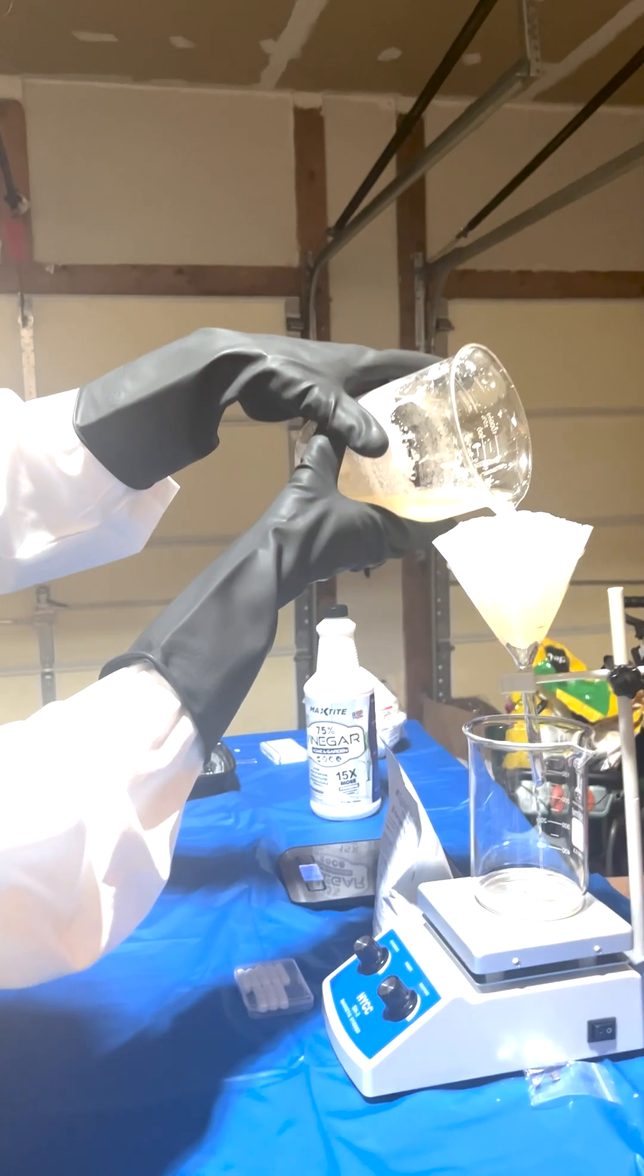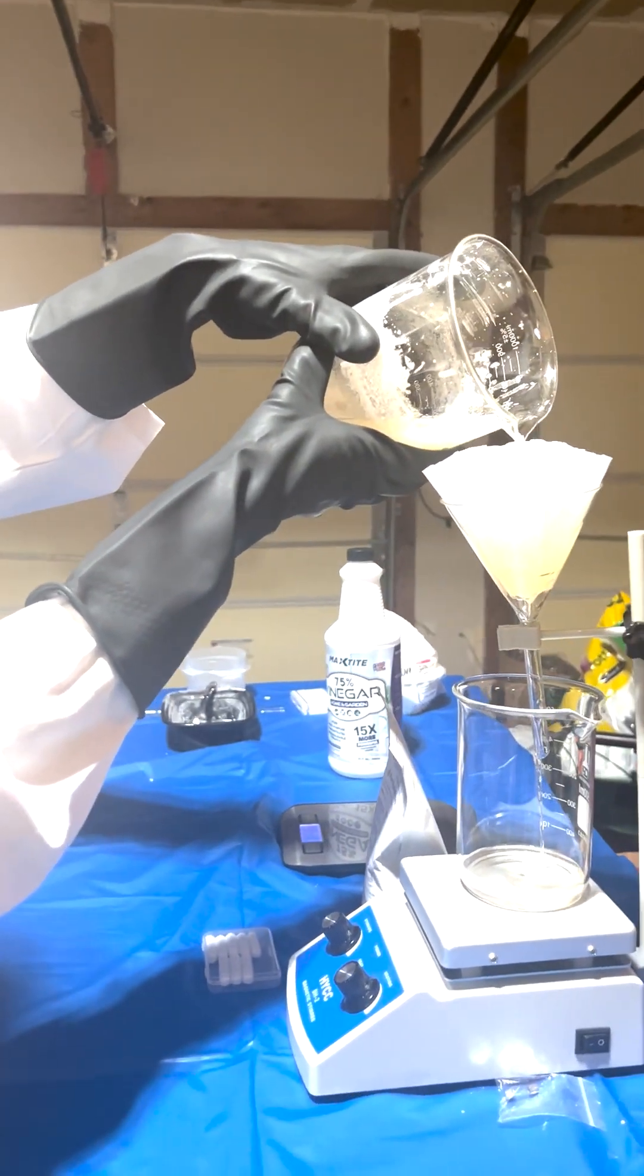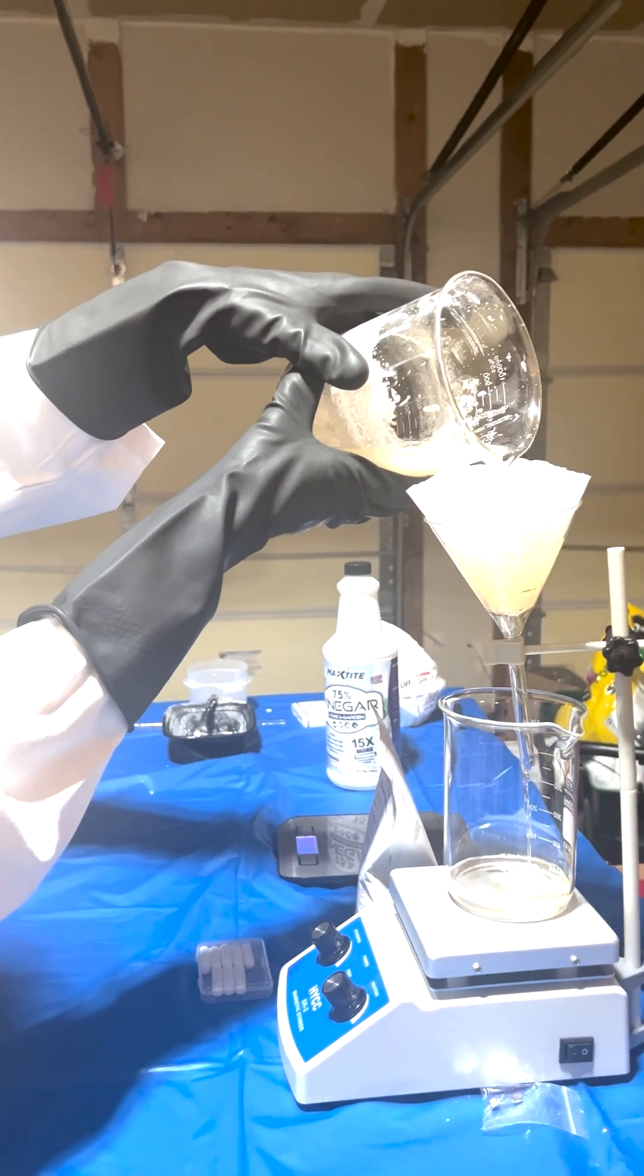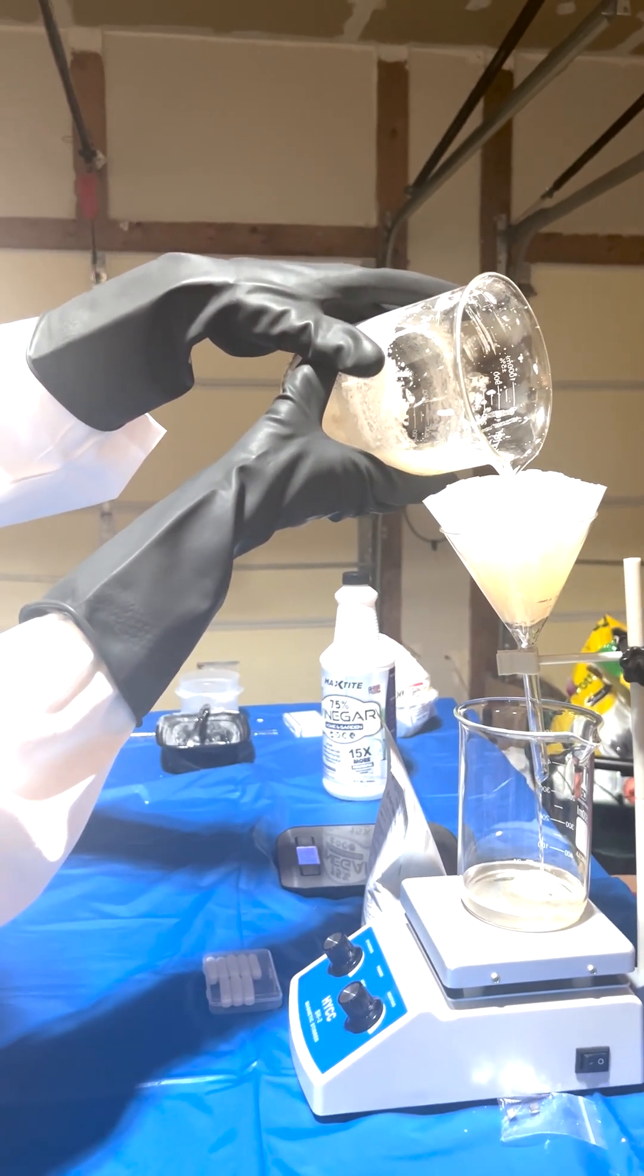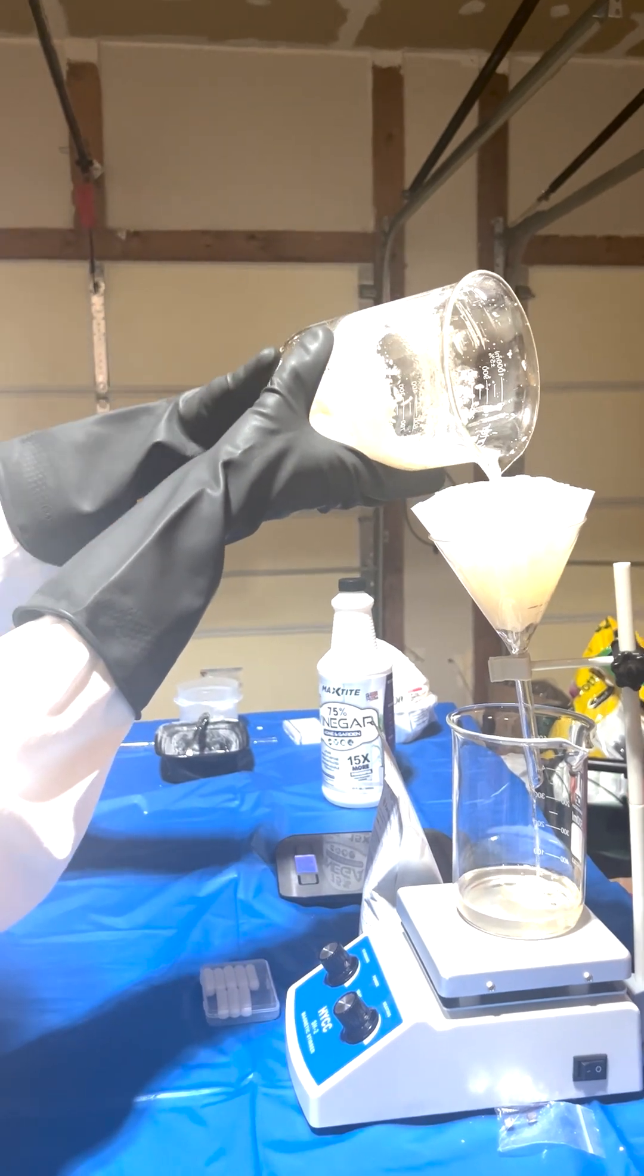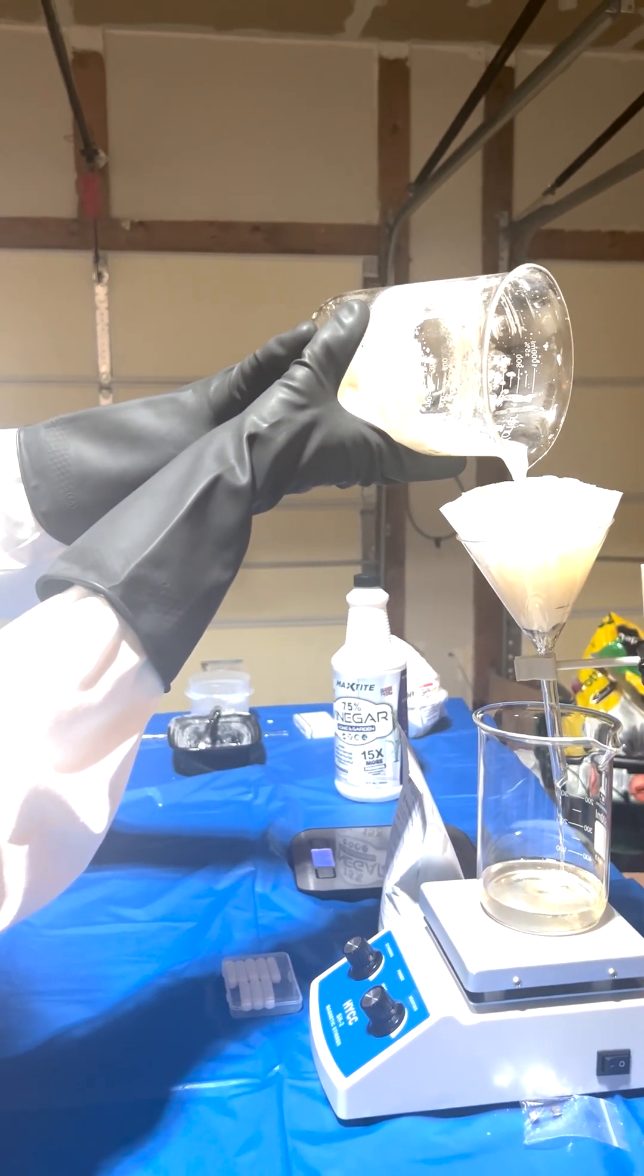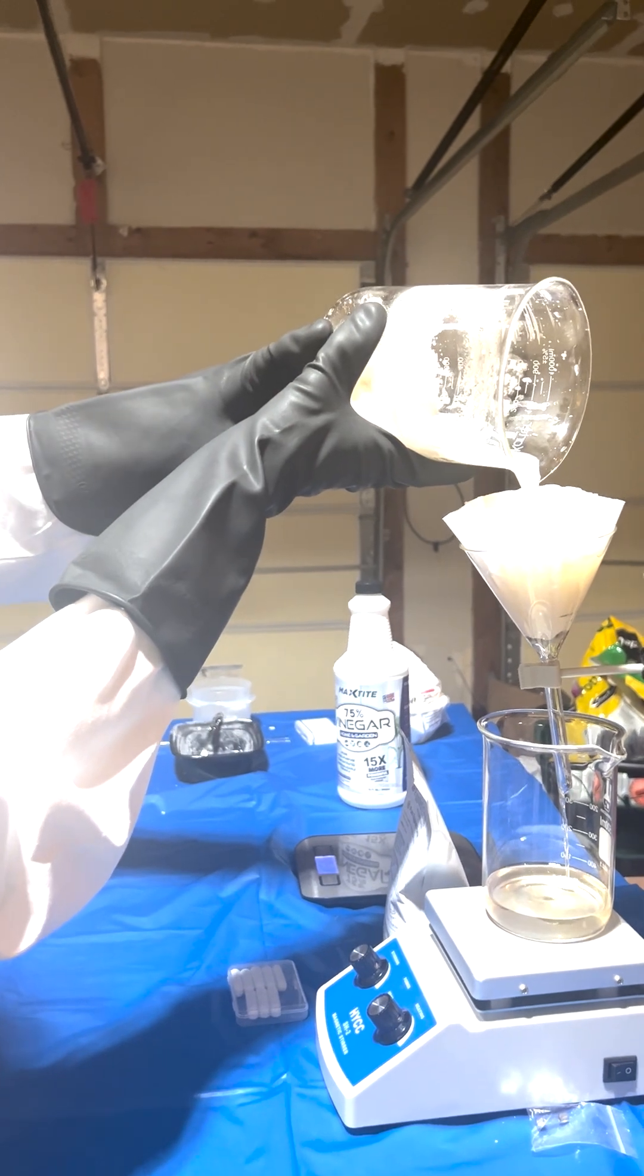So now we're filtering the solution through, so that it can trickle down. It should be a clear, off-clear color, slightly cloudy. We just want to drain away the impurities in it, at least the large ones.